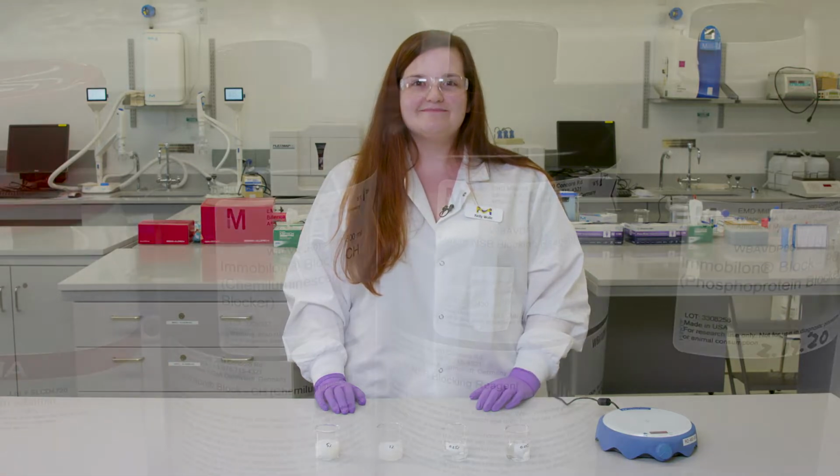Hi, my name is Kelly Wolf, and today I'm going to show you how to tell if your non-fat dry milk is completely dissolved in solution.